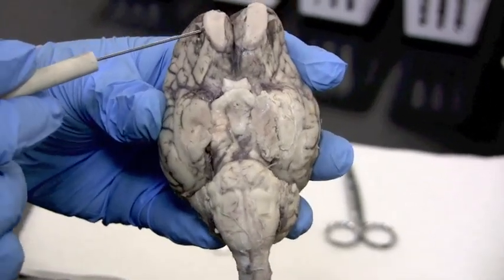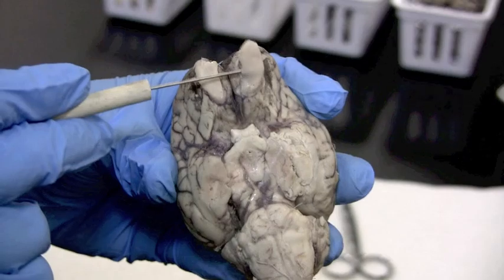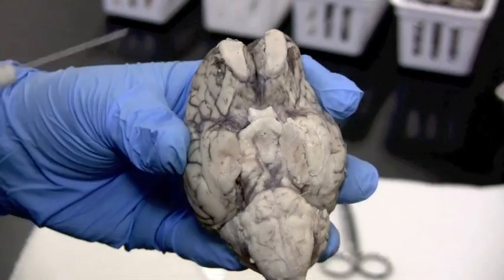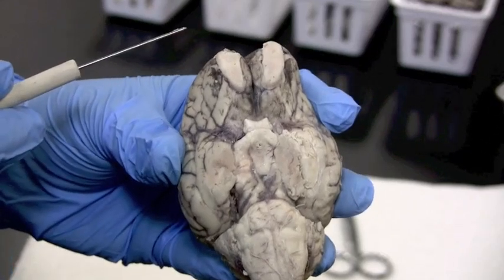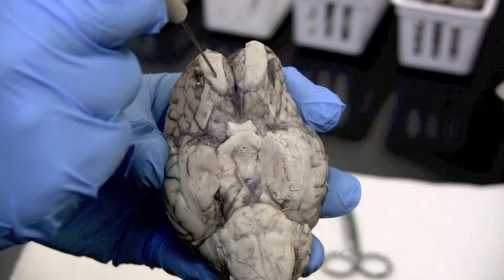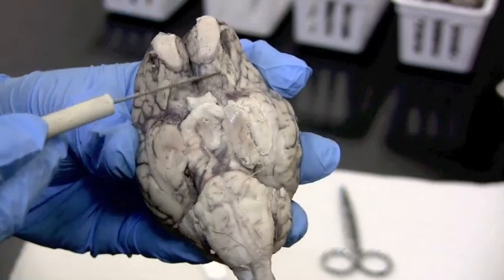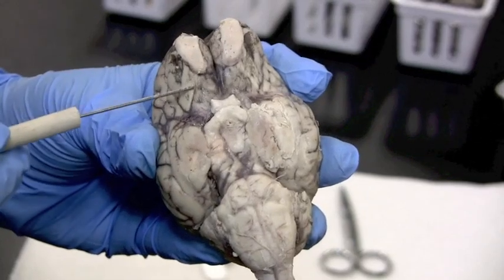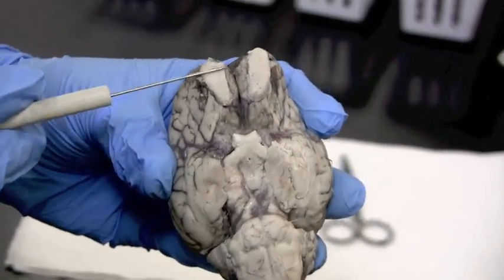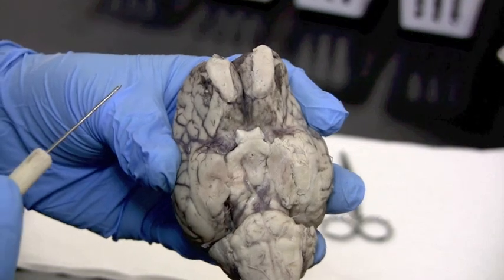Switching to this brain, which has a really good set of olfactory bulbs — these structures up here that are large and flat. They are in connection with the cerebral frontal lobe, with the olfactory nerves coming up through the skull bone and synapsing right there into the olfactory bulbs. A tract continues the information inside the cerebral hemispheres. These bulbs are what we consider, for labeling purposes, the olfactory nerve or cranial nerve one.